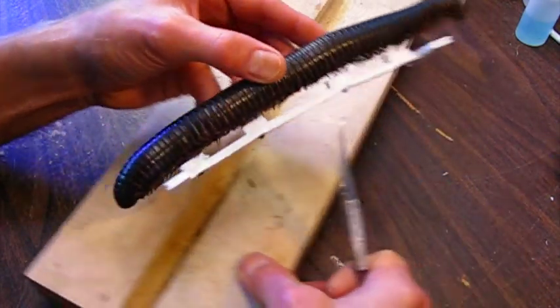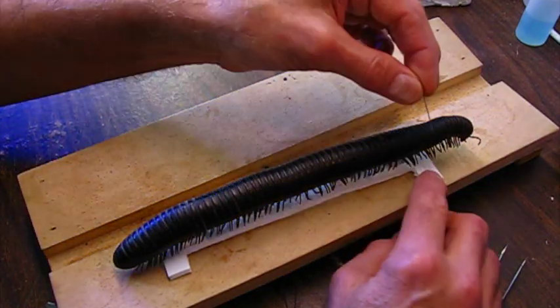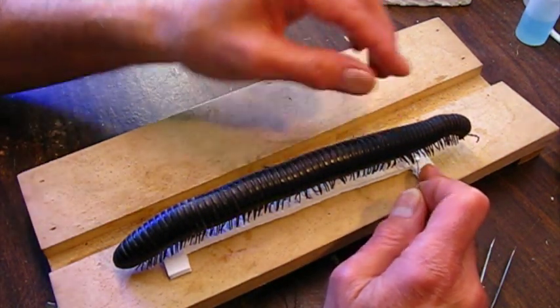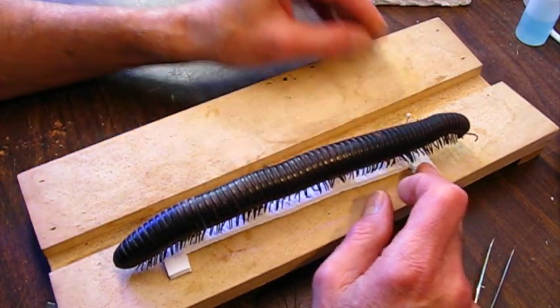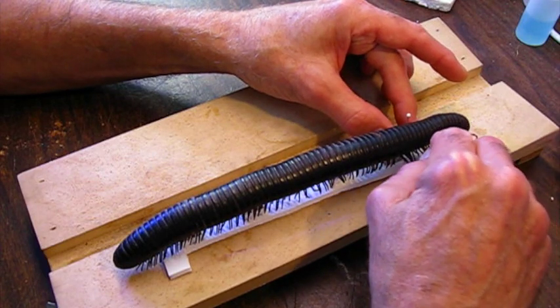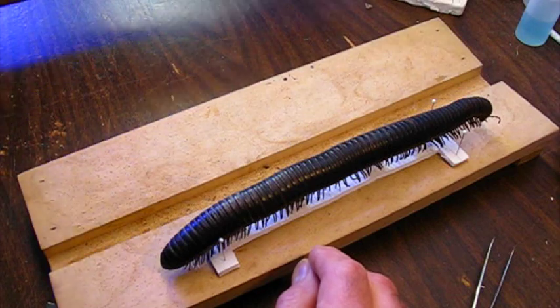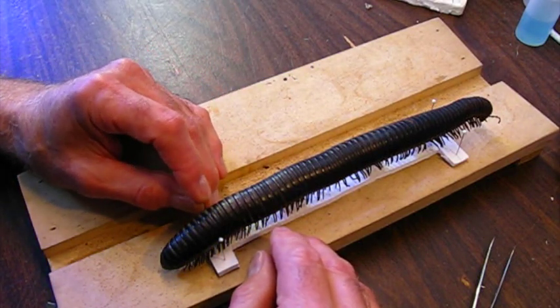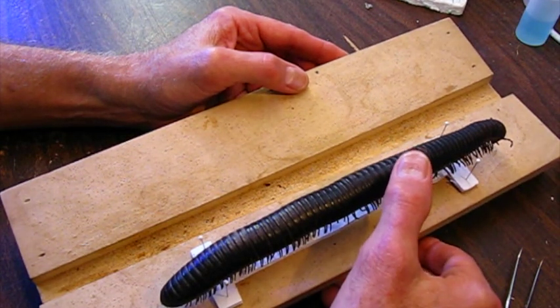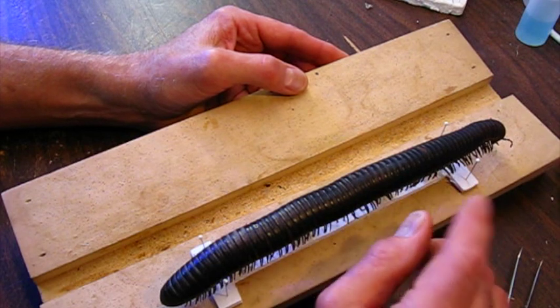It's not entirely flat, but let's see how it lays - yeah, that'll work. I can put four pins, one in each of these tabs, and it'll hold it in the box. I'll just stick one in right now using these little short sewing pins with the white head. Normally I would place this into the box in the teaching collection, but my non-insect arthropod box is in the process of being reorganized. When I reorganize that box, I'll shoot a video and you can see it go in.